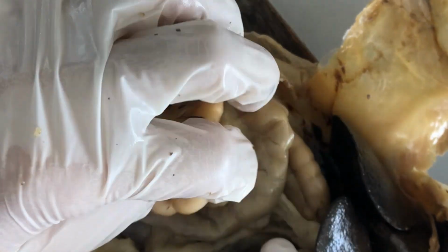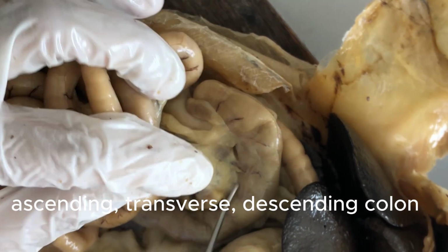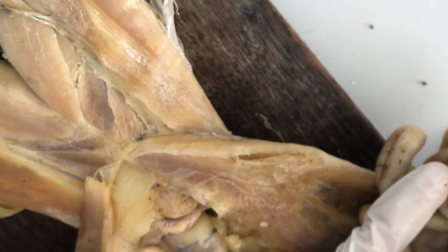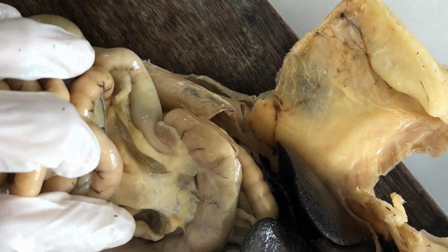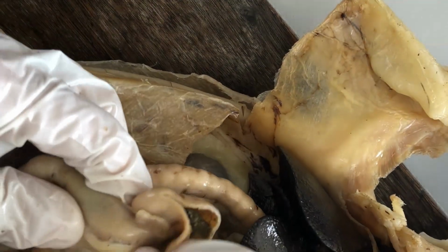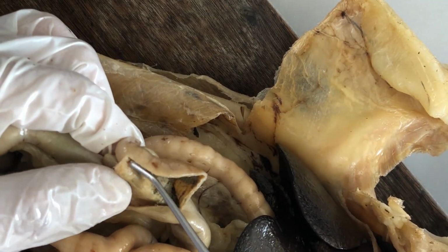Right, and then the large intestine or colon portion of it is divided into an ascending, this is ascending, transverse, and then descending colon. And then it will continue inside the pelvic cavity as the rectum. So we'll check it out when we go to the urogenital system. But ascending, transverse, and then descending colon. And then at the junction between the ileum and the ascending colon, you have to dissect the ascending colon somewhere here to be able to see.